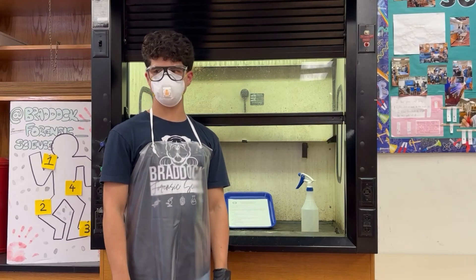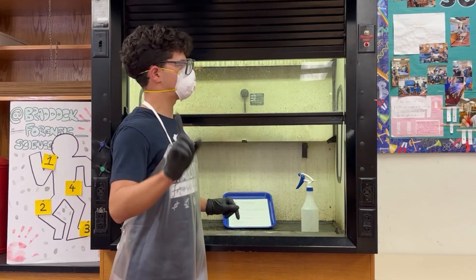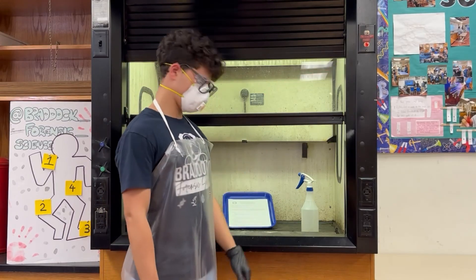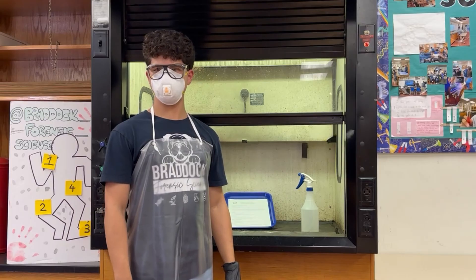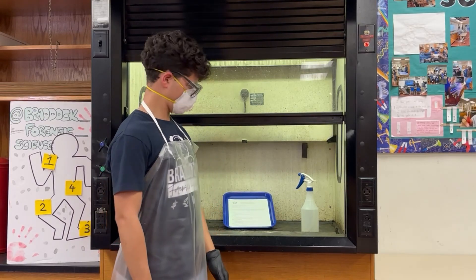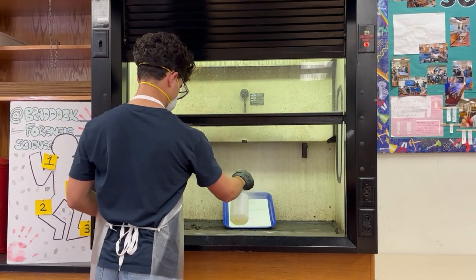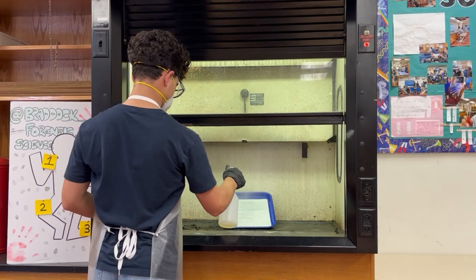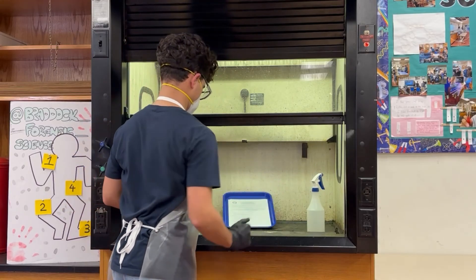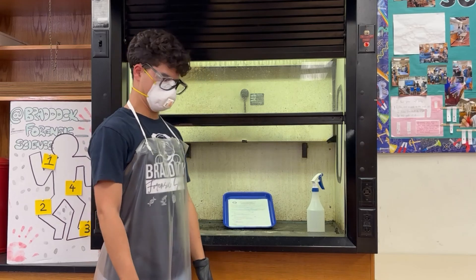Now let's get into the steps. As promised, this will be an easy procedure. Place the sample that you are analyzing on top of a tray — you can use a plastic cover or anything else that will prevent a mess and will be easy to clean afterwards. From a distance, spray the chemical on the paper. If you spray too much of the chemical, it could soften the paper, which could crumble or destroy it. The fingerprints are also erased if you add too much of the liquid concentration.